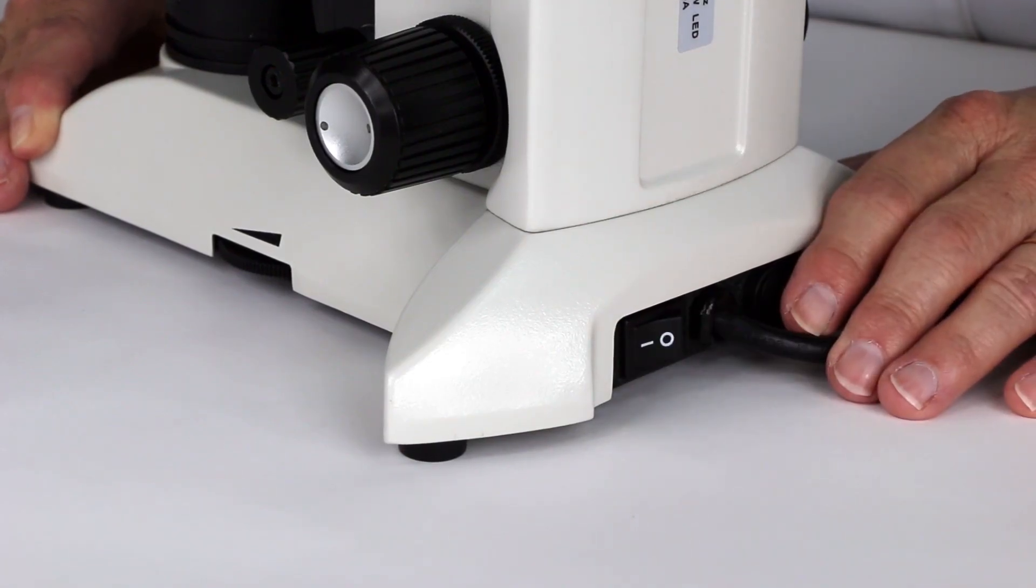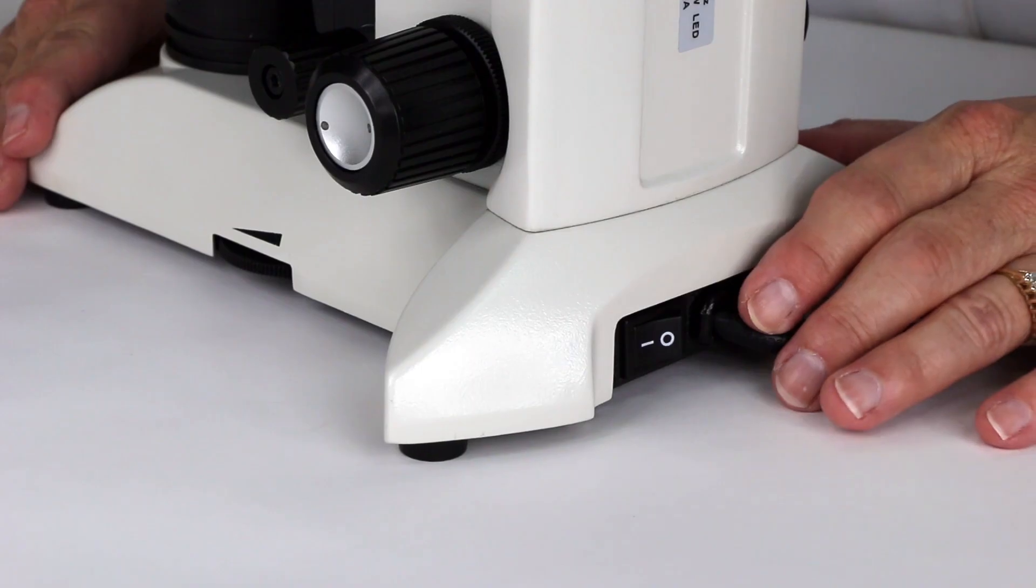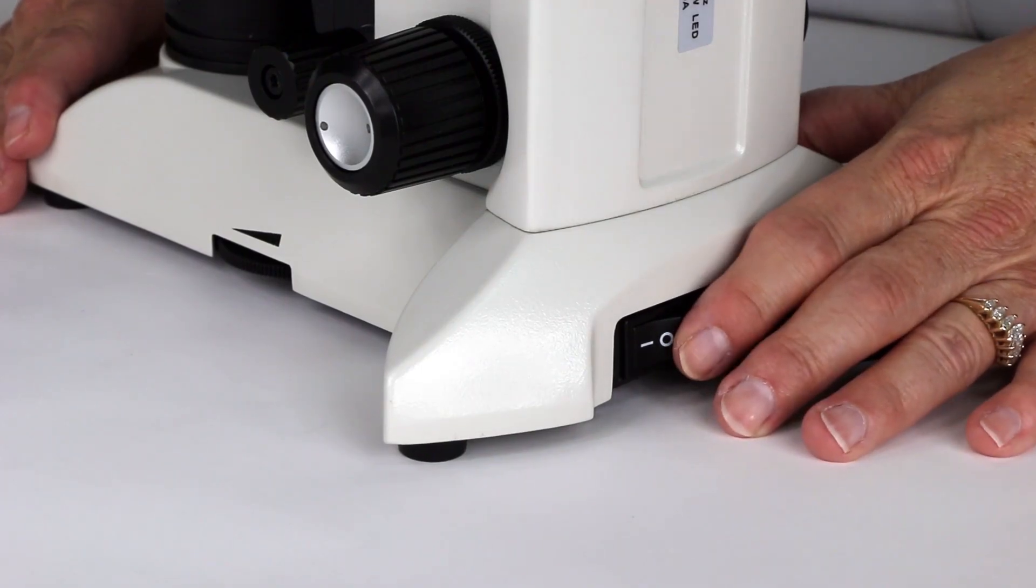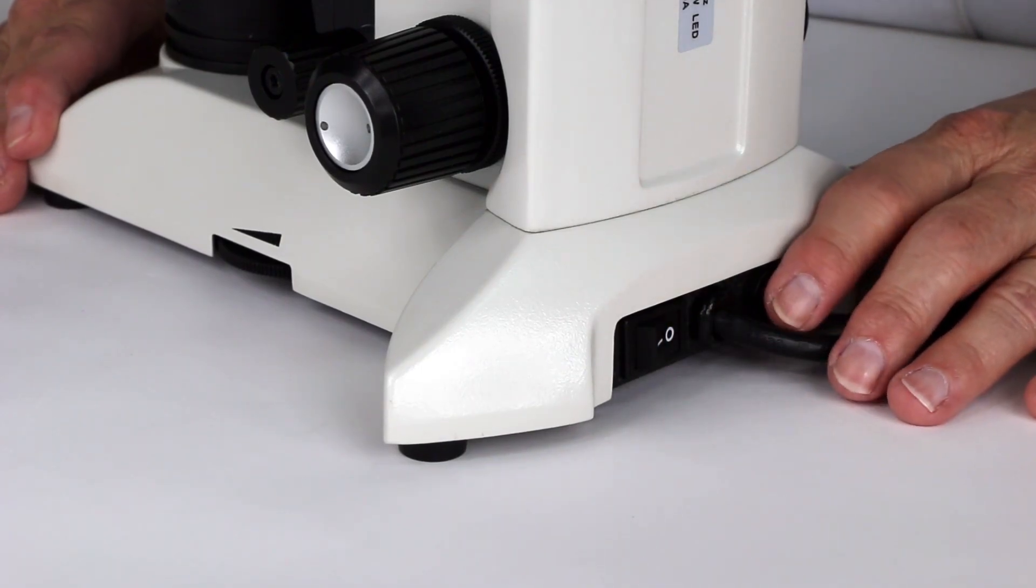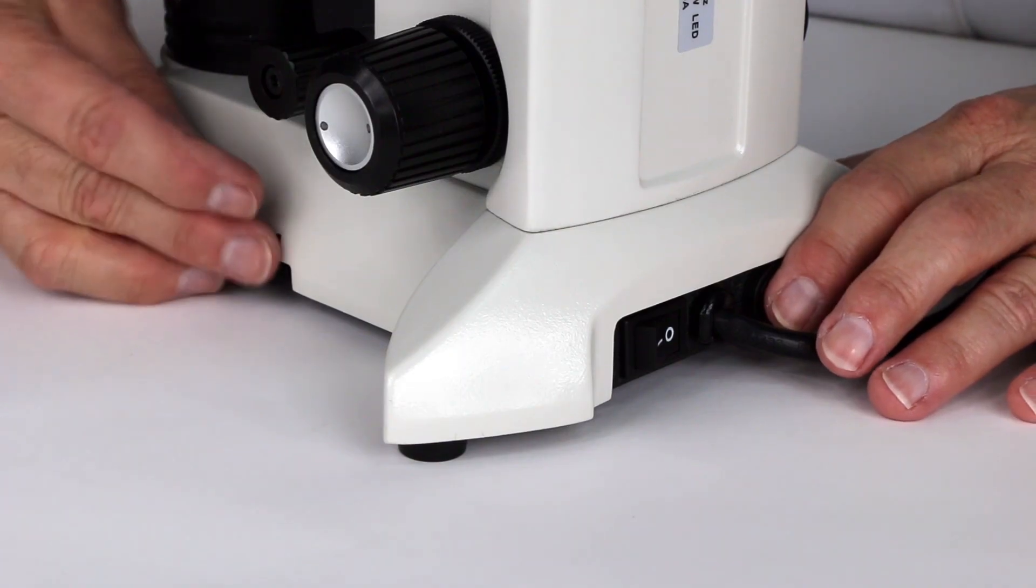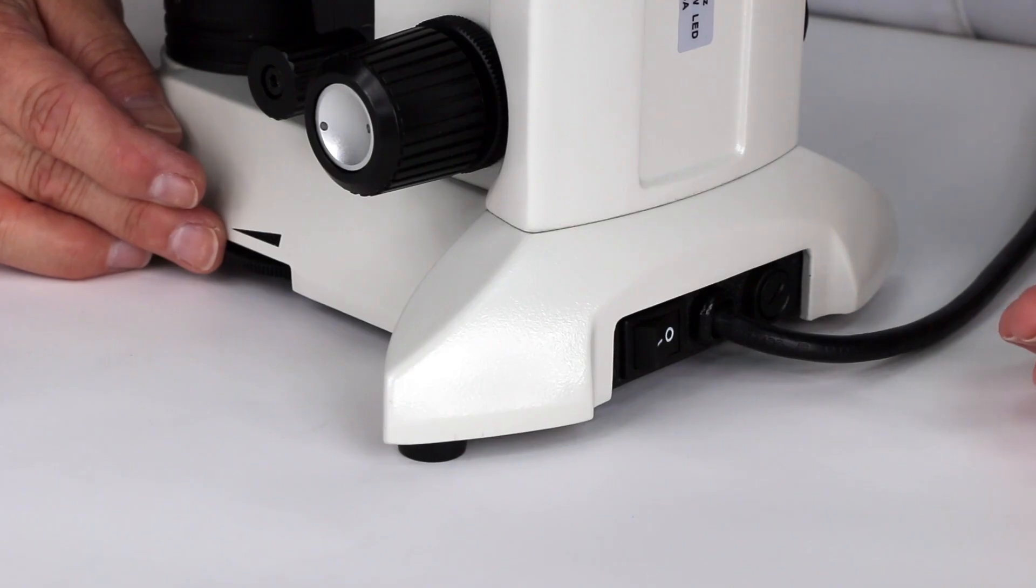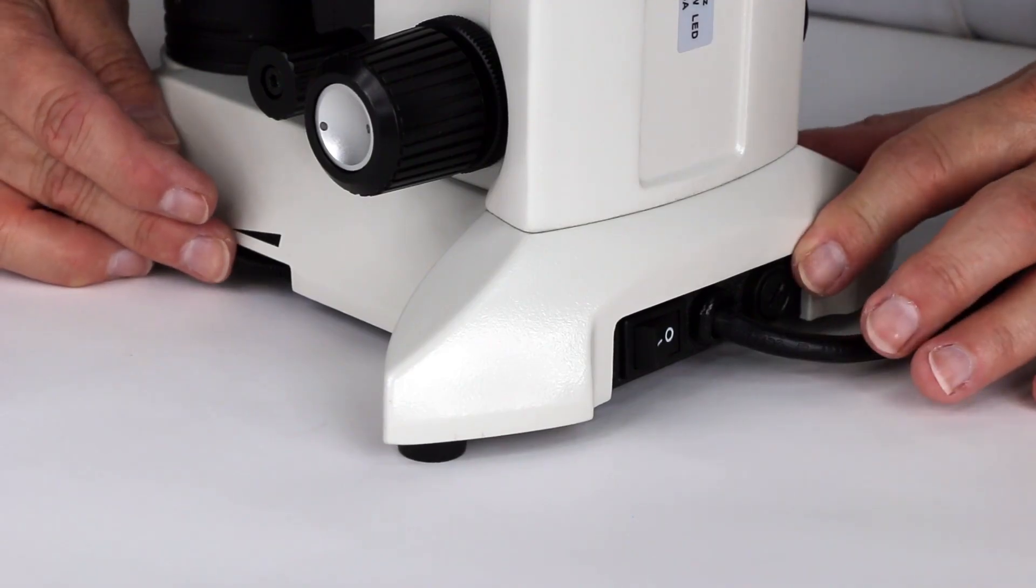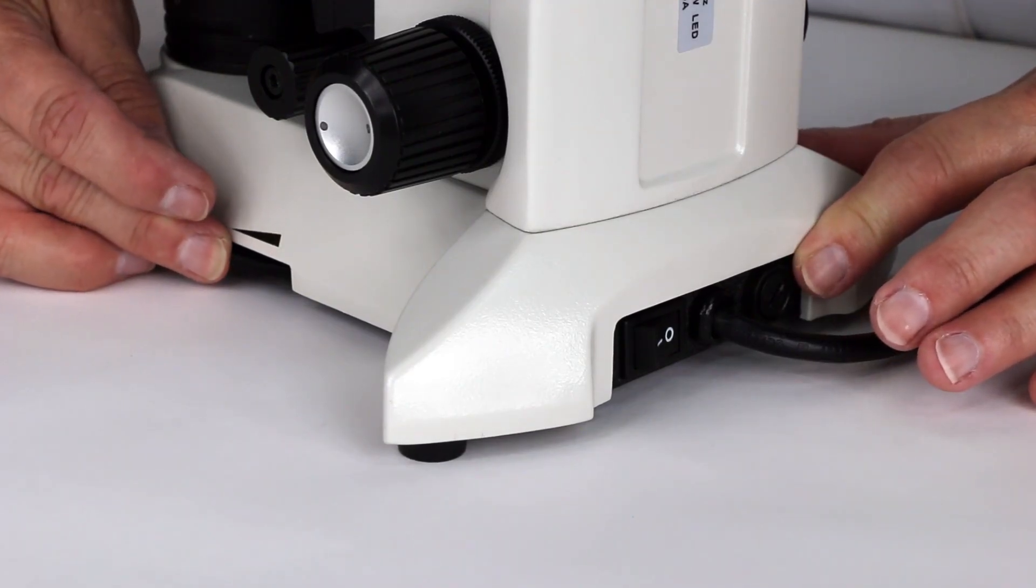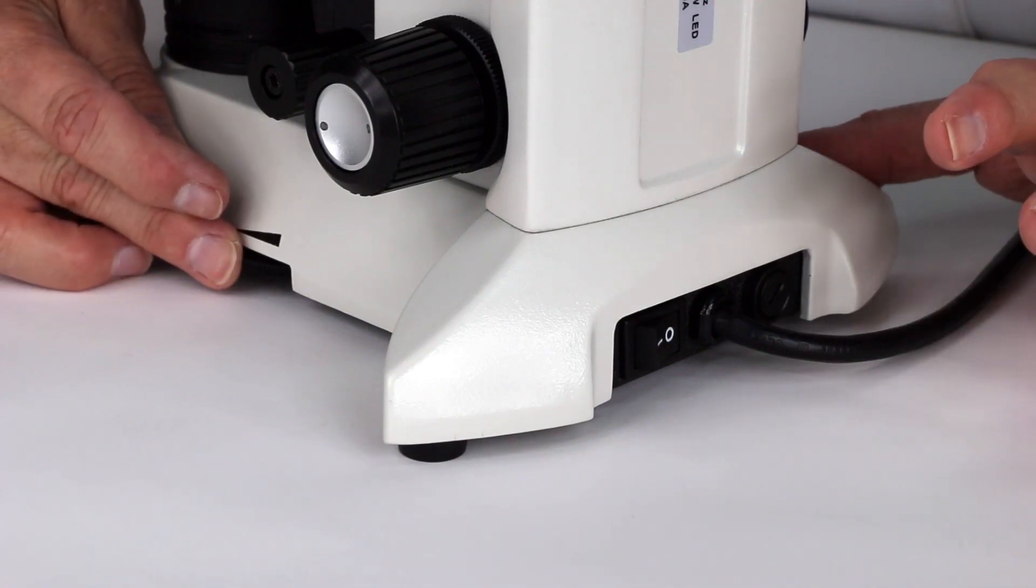And there's an on and off switch someplace on your microscope, even if it's not in this particular location. The light intensity dial is on the side. And sometimes it's too low, maybe set on one, and no light will show through. So then you need to change that intensity level by turning the knob and making sure that that's not your problem, too.